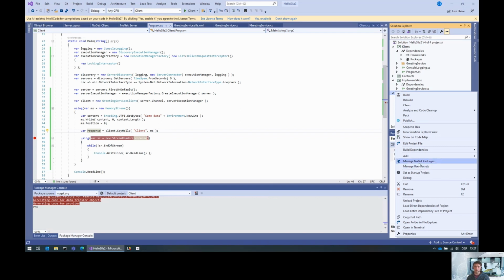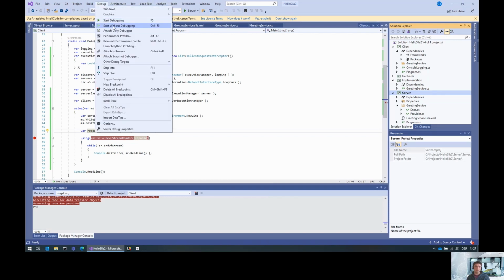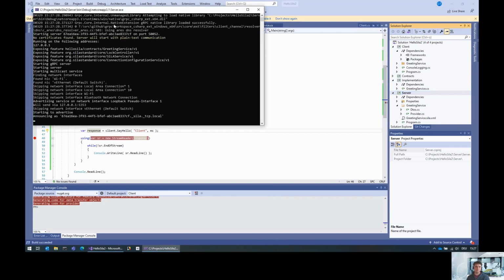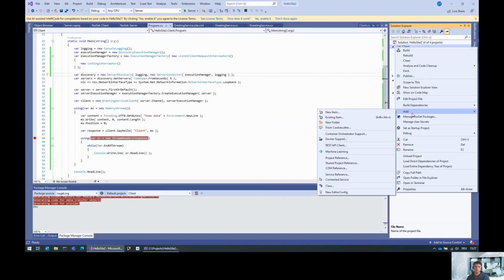Okay, so then we can set this up as a starting point and start this. Okay, and then the client.